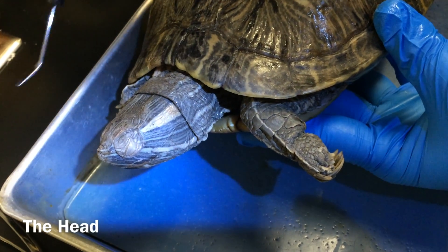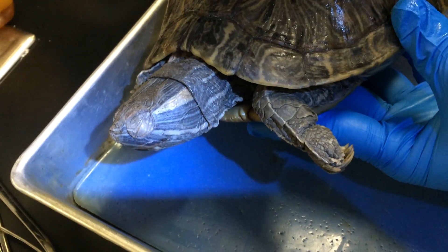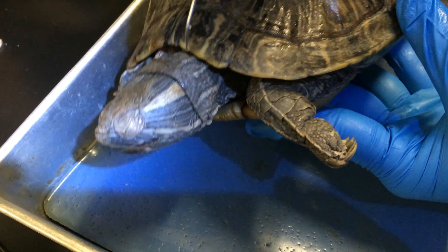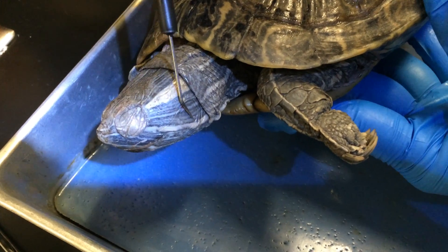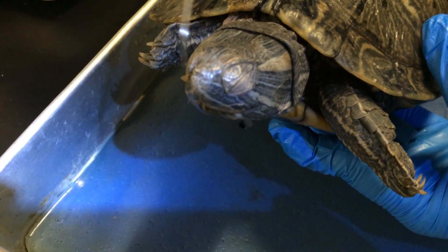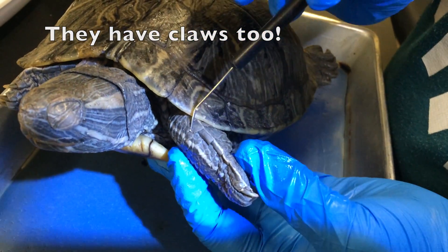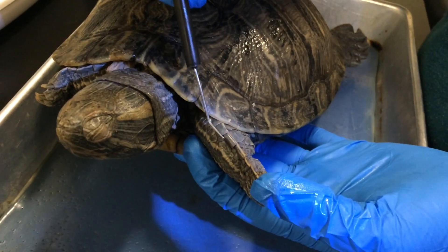This is the head of the turtle. Here are the eyes. Like frogs, turtles have a nictitating membrane which acts as a third eyelid and protects the eyeball when they dive underwater. Here are the external nares that the turtle uses to breathe. Since it doesn't have any ears, it uses this eardrum — a tympanic membrane located right behind the eyes. They do have very poor hearing. Since turtles do not have any teeth, they use this beak-like structure to tear at food. The skin of the turtle is very tough, has overlapping scales, and is used for protection as well as keeping out water.